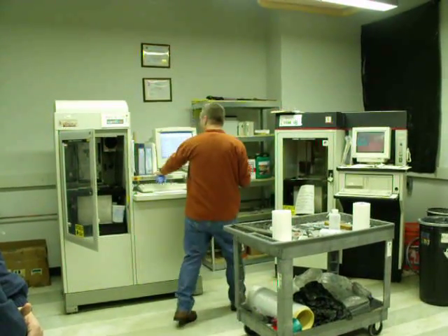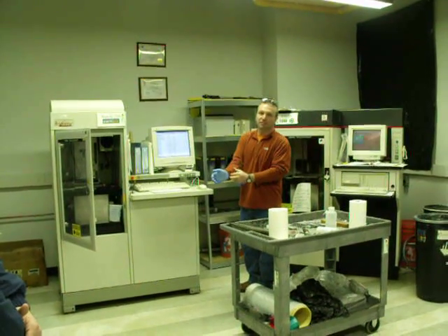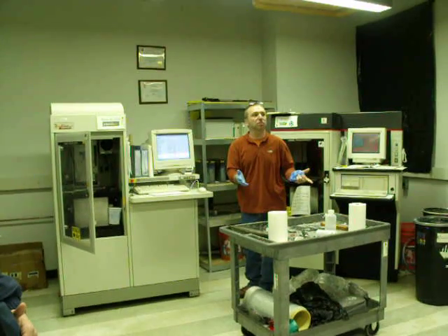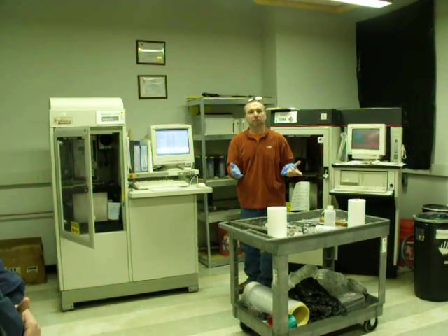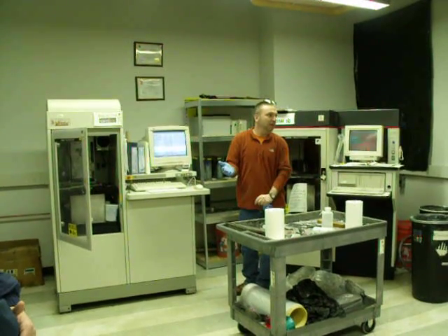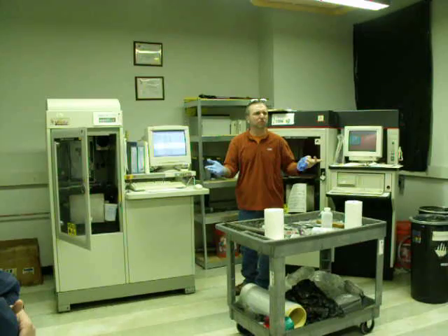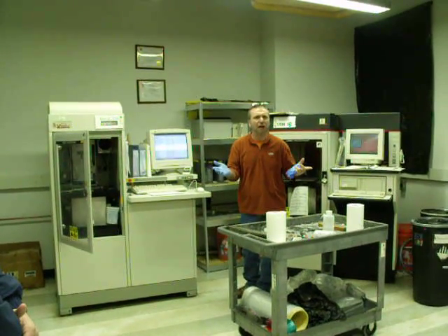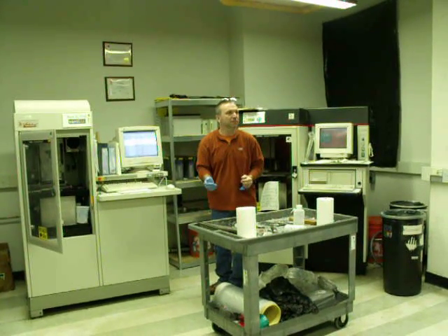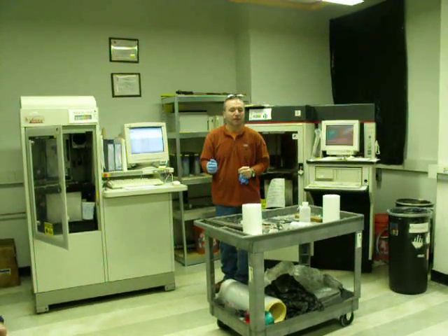I noticed there was resin all over this, all over the mouse, all over the keyboard. I mean, it's really unacceptable. And I'm not blaming anyone because I'm not sure what kind of training you had. I know Pete's been kind of trying to take up the slack lately, but was anyone trained by Andrew Layton? Yeah, so some of you came in at that time here, and I'm not sure what kind of training he did.